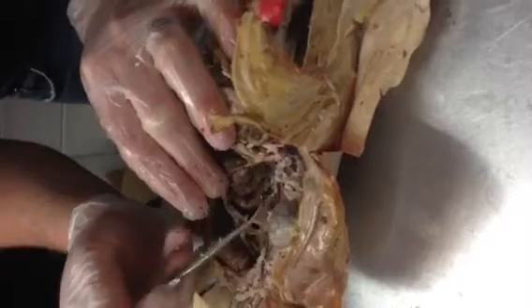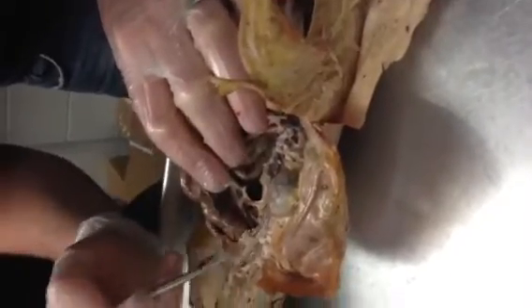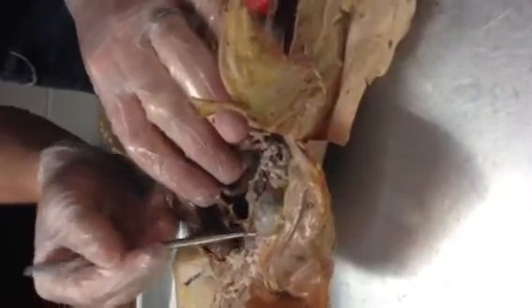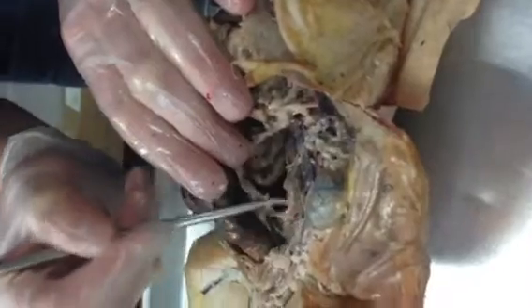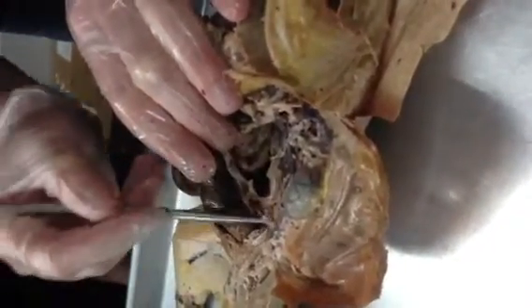Did we skip the gonadal? Yeah, so the gonadal. So this is a male cat, and so remember that the testes are descended down, and so here's the gonadal artery and vein right there. Oh my god, I don't even know what I'm looking at. Yeah, running all the way down, right? So they run, see right there?